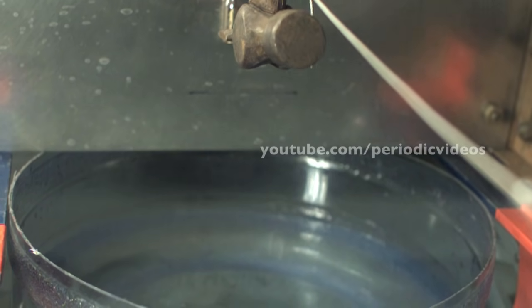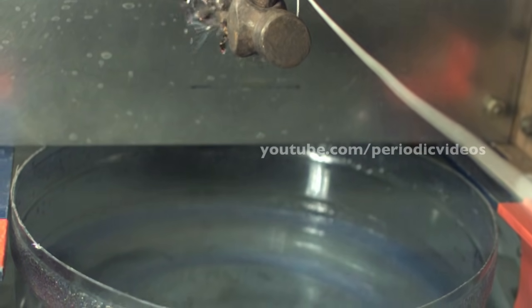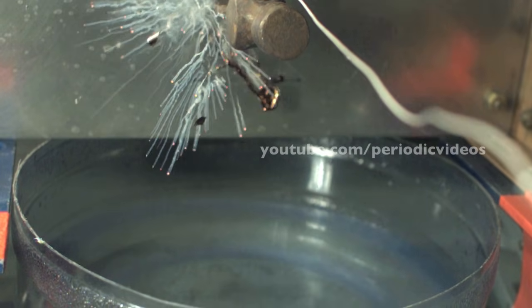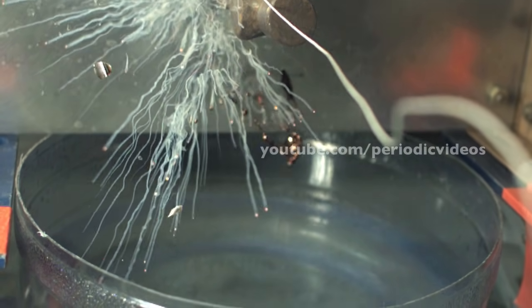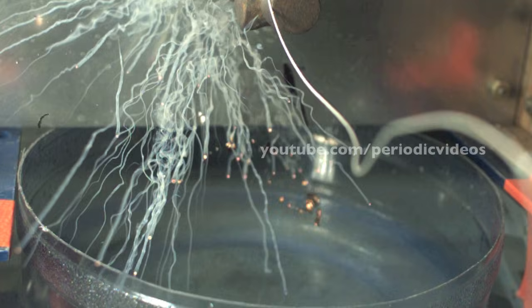What was surprising is that you can see these individual droplets of metal have a vapor trail. They're clearly reacting with something in the air. It could be oxygen, but we think it's probably due to water vapor. With the hot lamps, there's quite a lot of vapor coming from the water.